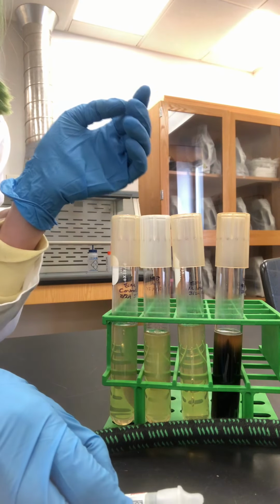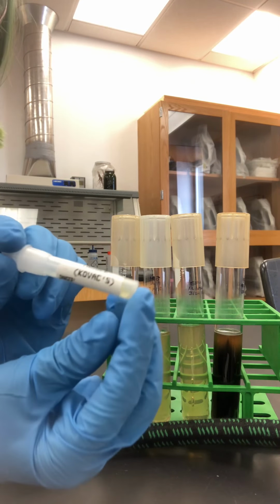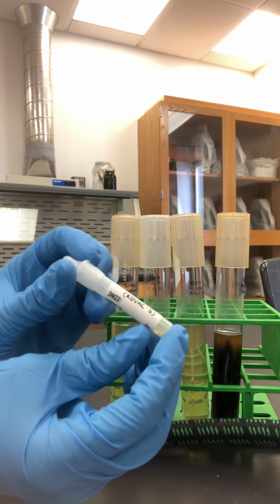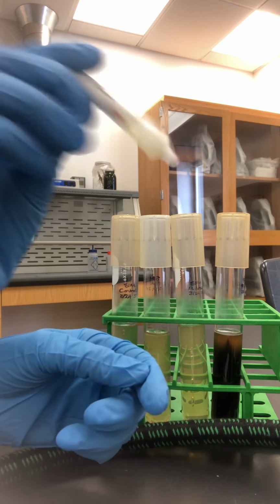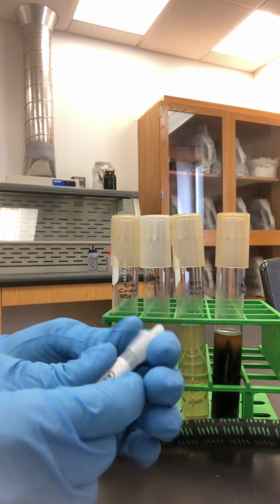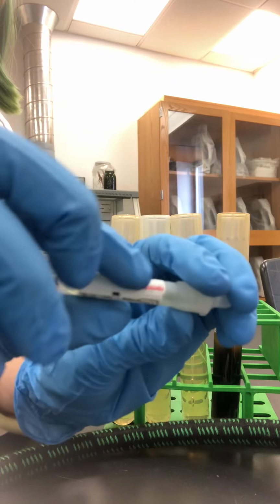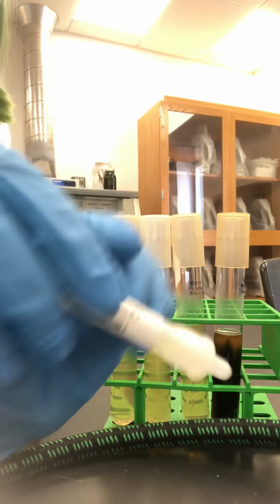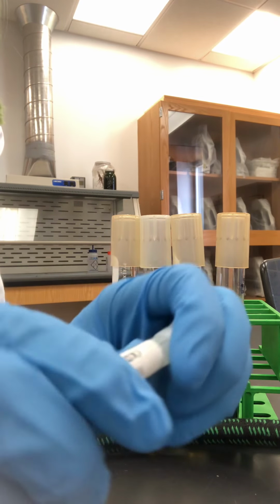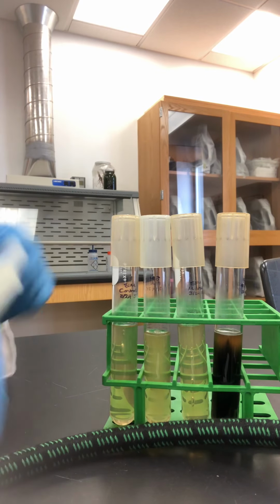Now we're going to look at our last part, the indole production. So what we do then is we're going to put on some Kovacs reagent. To put on Kovacs reagent, we have these little tubes with the reagent, and to open them we have to use it like if you've ever had a glow stick. The reagent is in a glass tube inside this, and then it's a dropper. So to open the glass tube, you just have to crack it, as if you were opening a glow stick, and then it can drip out.